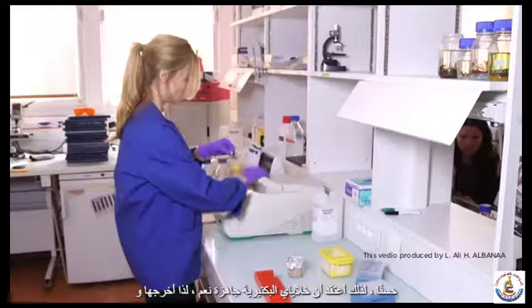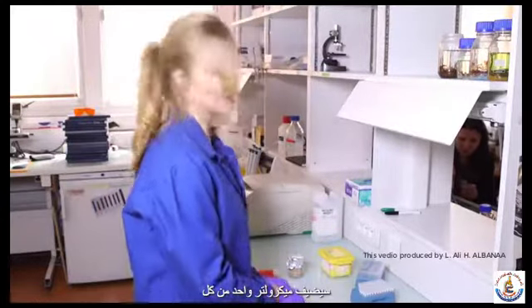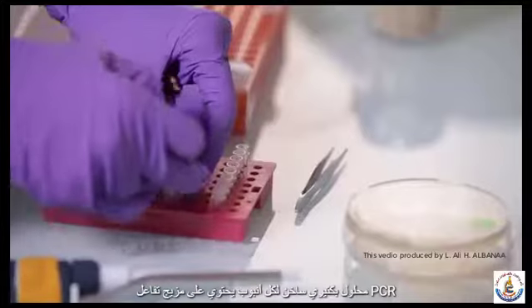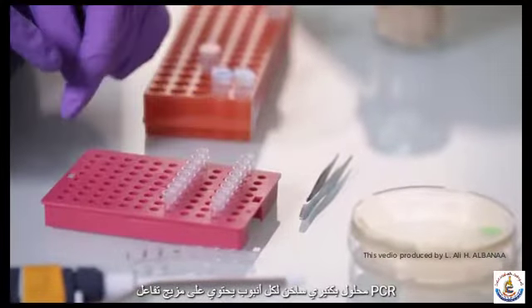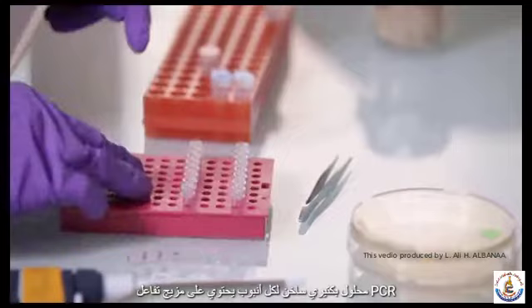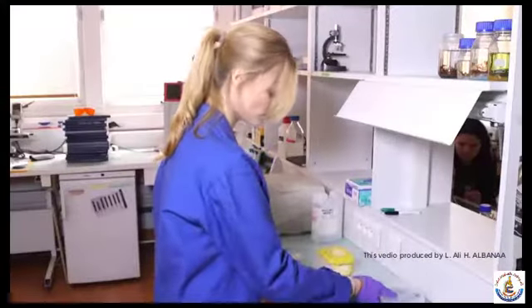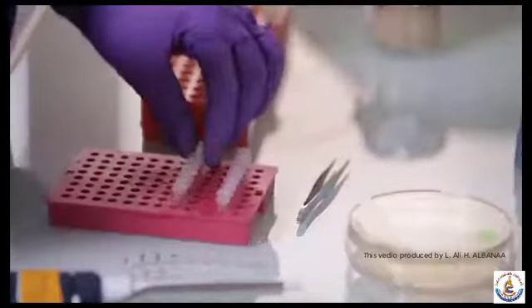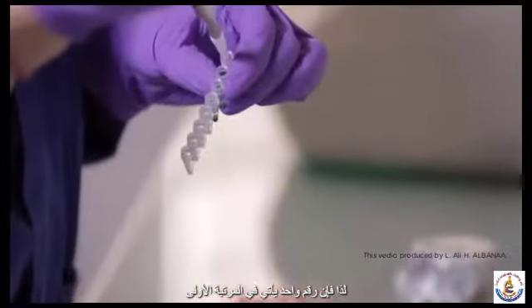So I take them out and I will add 1 microliter of every heated bacterial solution to every tube that contains the PCR reaction mix. So number 1 goes in number 1.